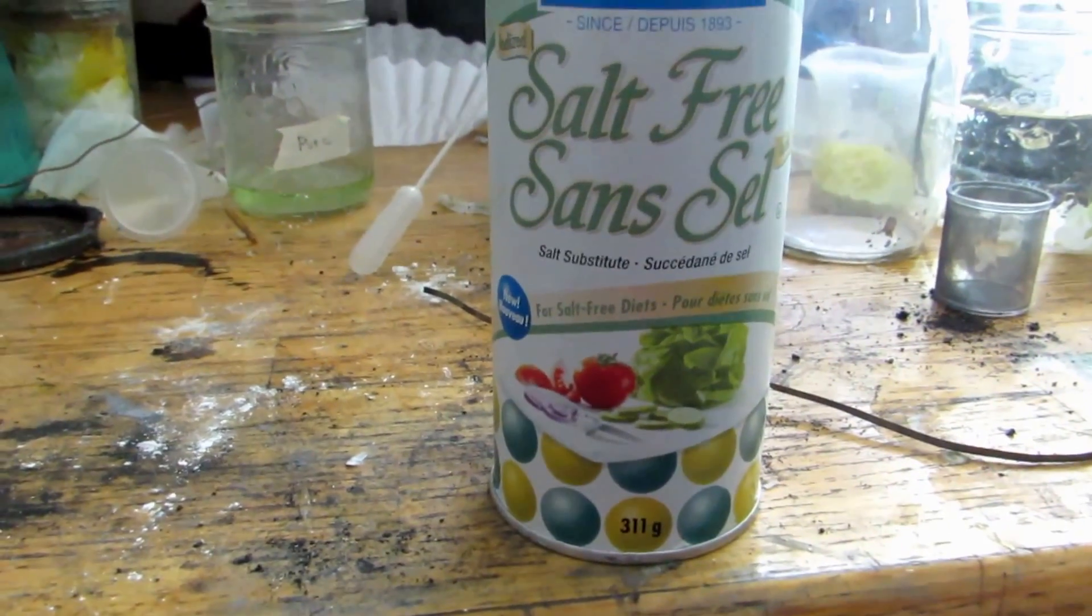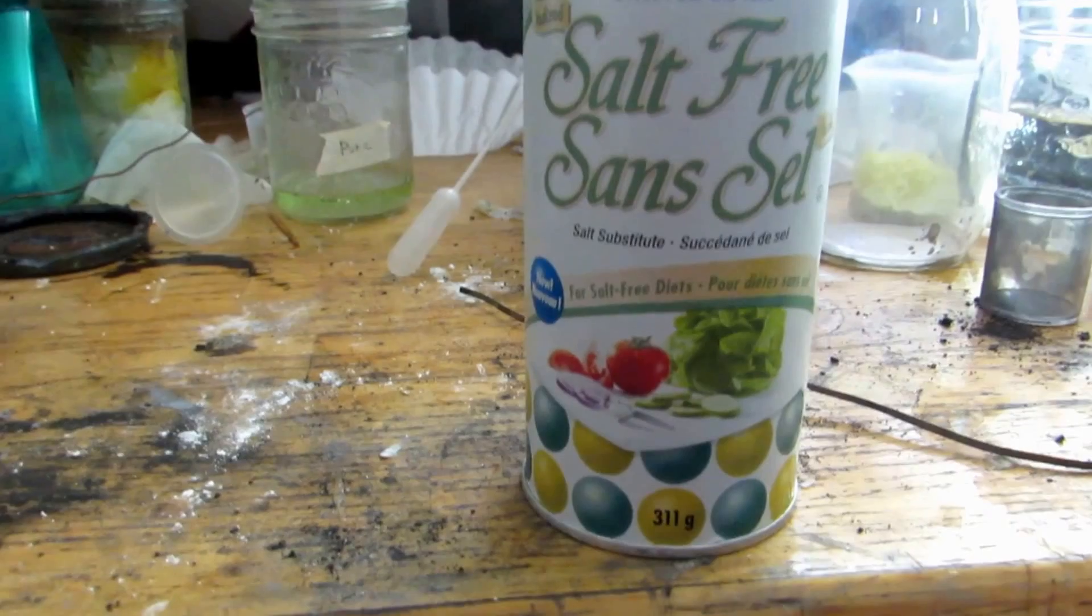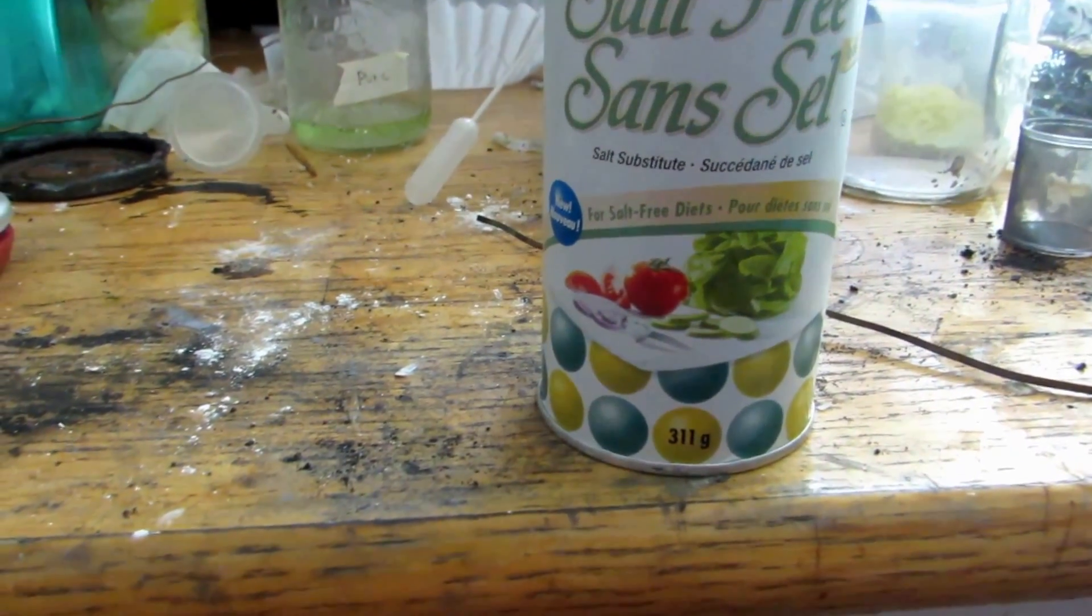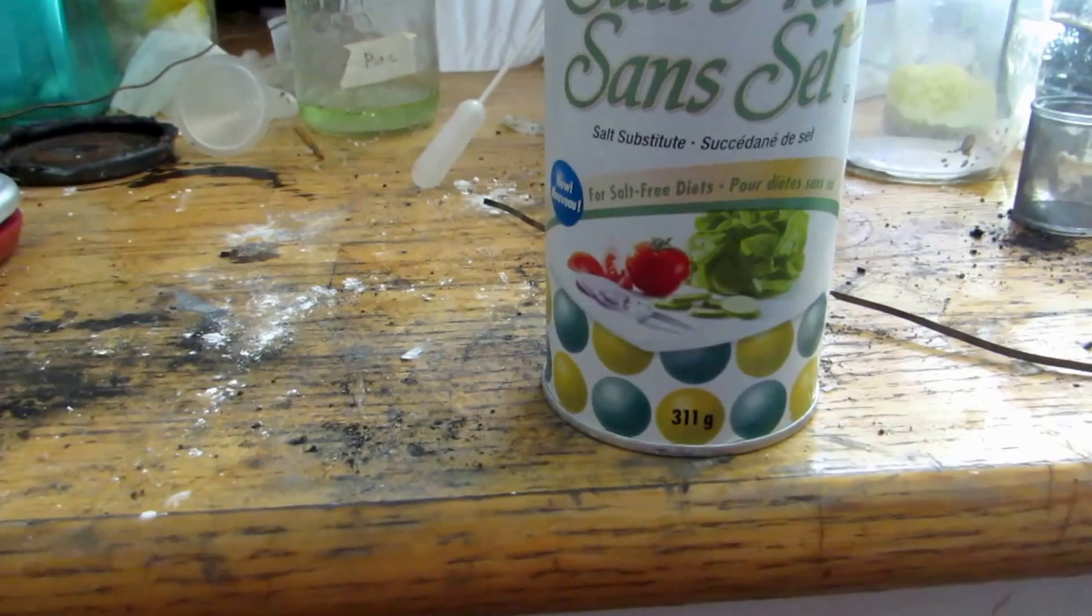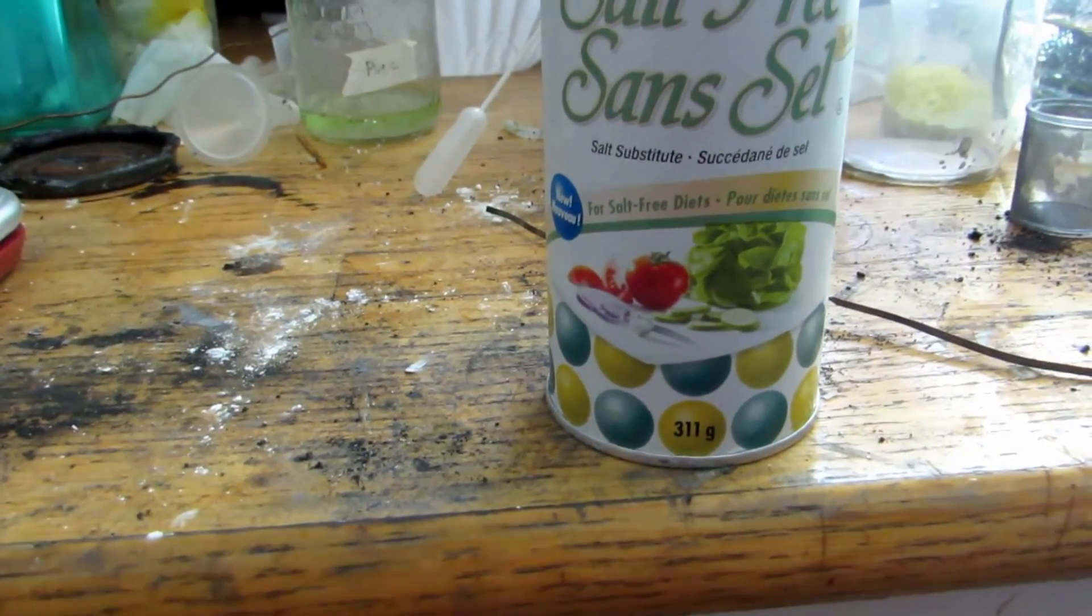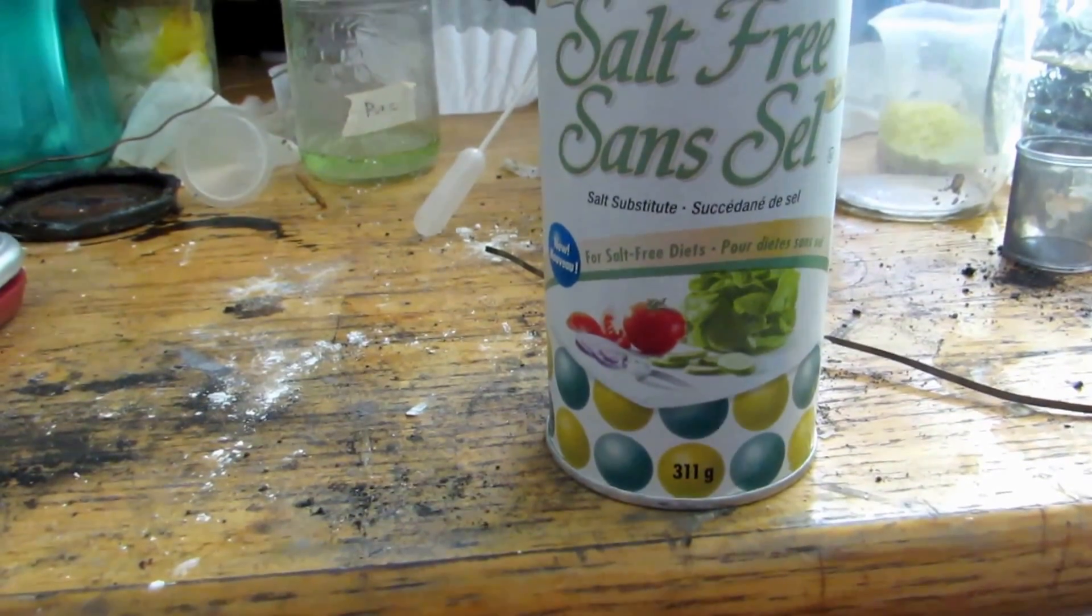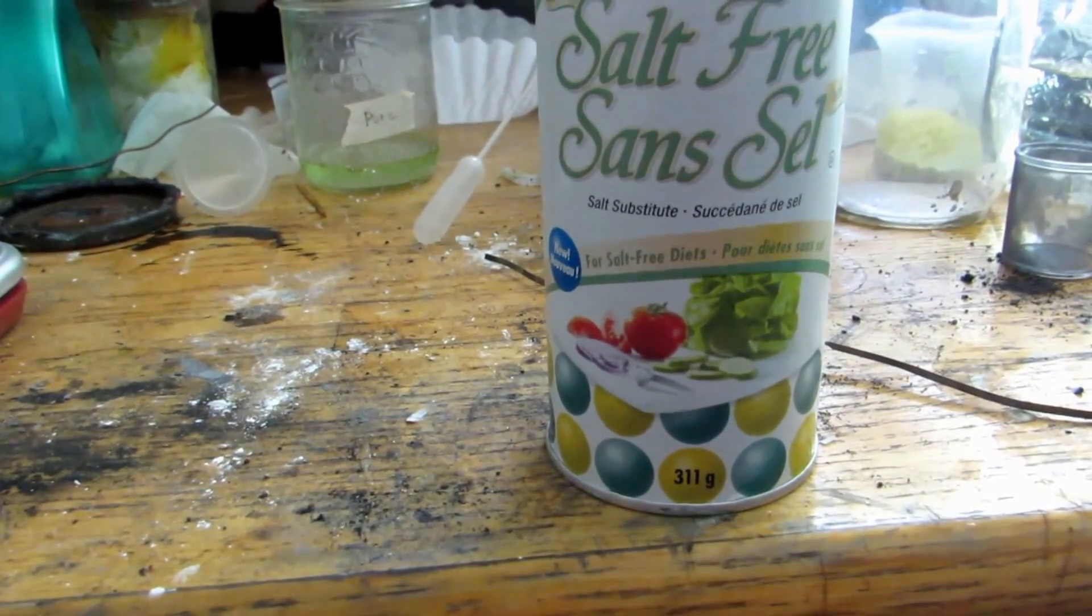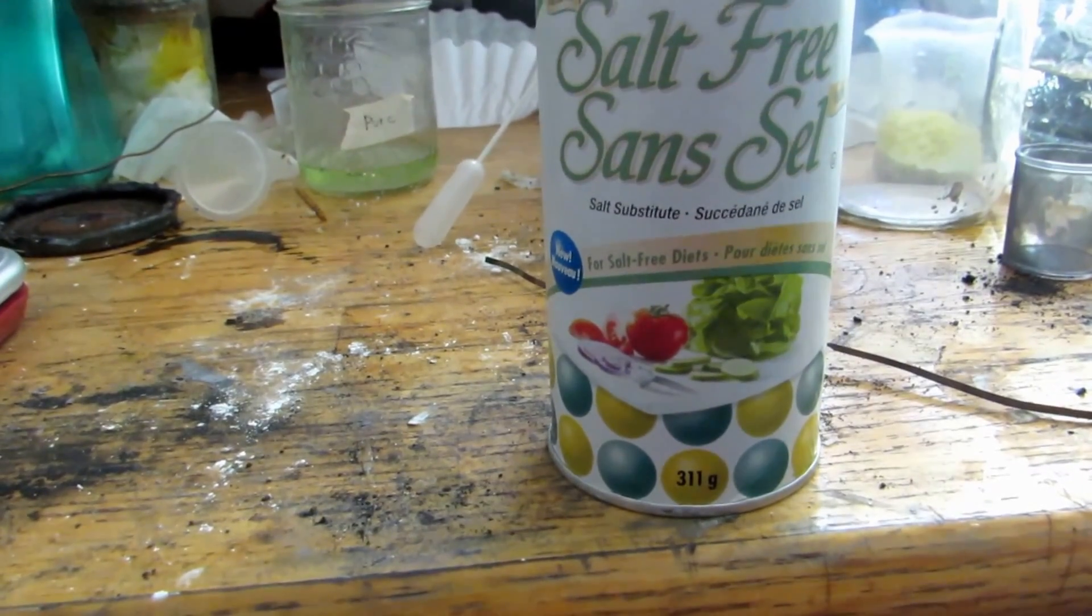Okay, so I'm actually sorry I was greatly mistaken. It is not ammonium chloride to use. That is what they use for the production of barium. So with barium, that is how I plan on doing it. Because barium chloride is also used in fireworks to give a green color. So if you did see any green colors in your fireworks, save that powder also because in a future video we'll isolate barium from that.